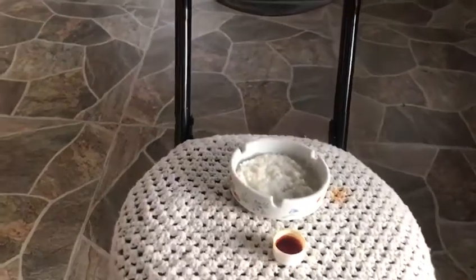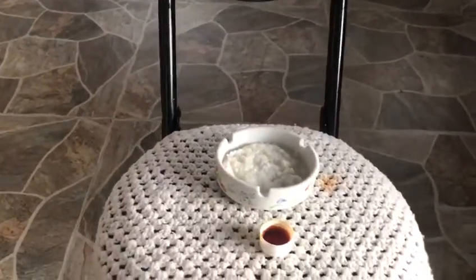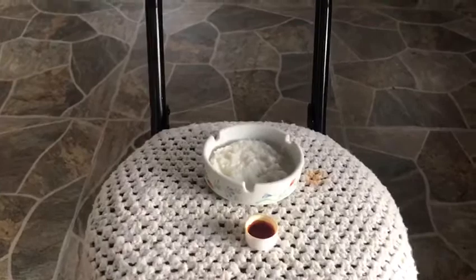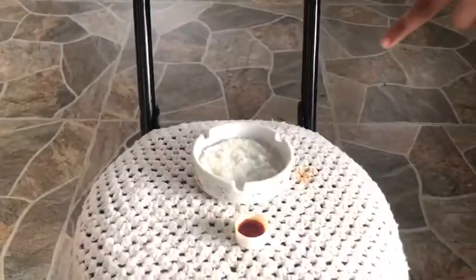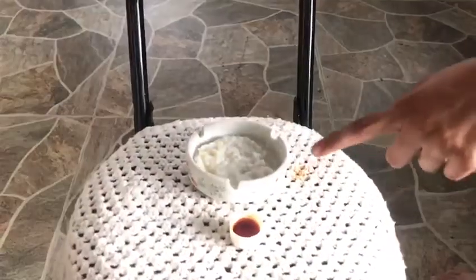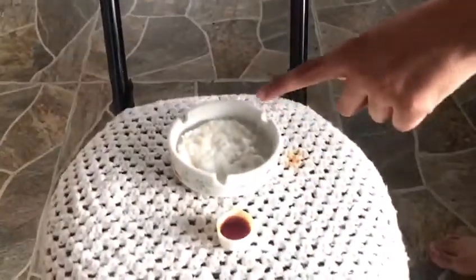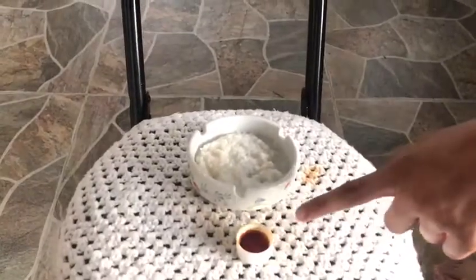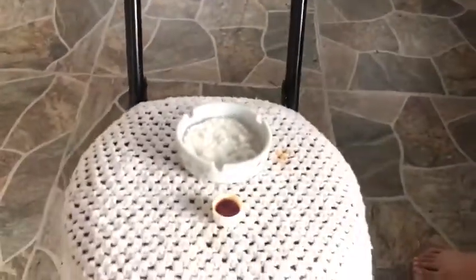Hi everyone, today I'm going to do an experiment based on starch. For that we will need some rice and potato-like starch foods, and some drops of iodine solution. Now I'm going to add iodine to the rice.